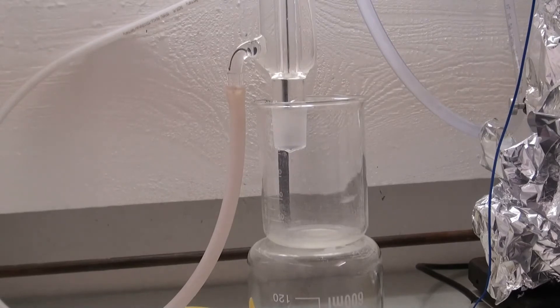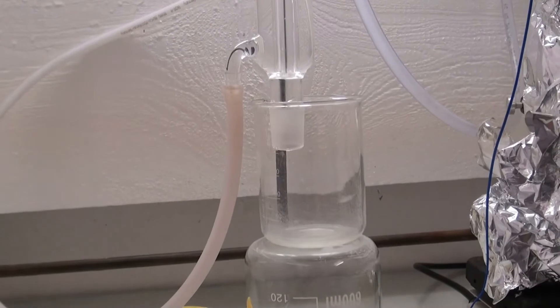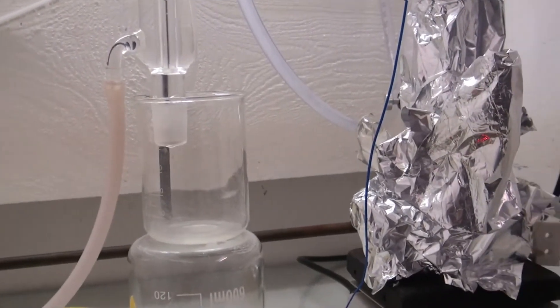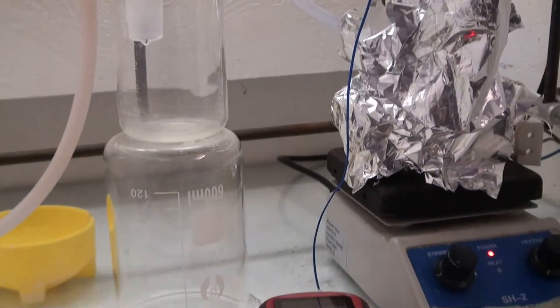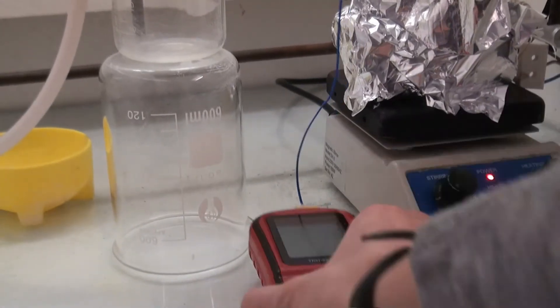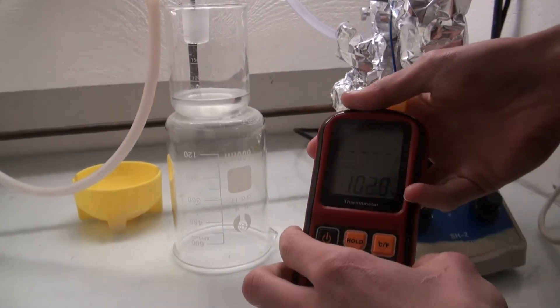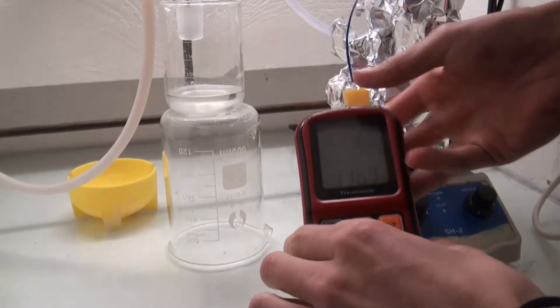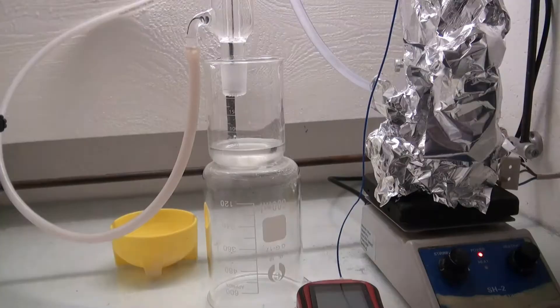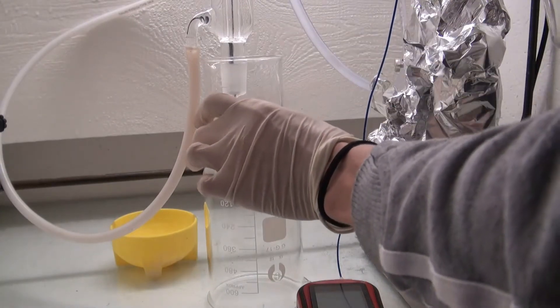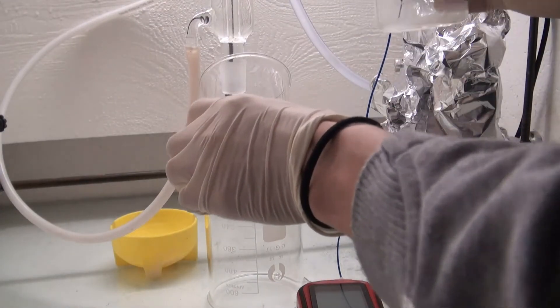After about 30 minutes the first distillate came over at 98C. Over the course of one hour the temperature rose to 104C, and the collection beaker was changed to collect the fraction up to 120C.